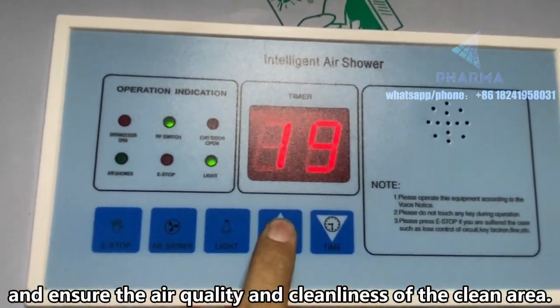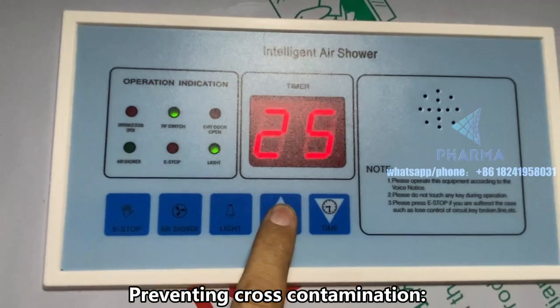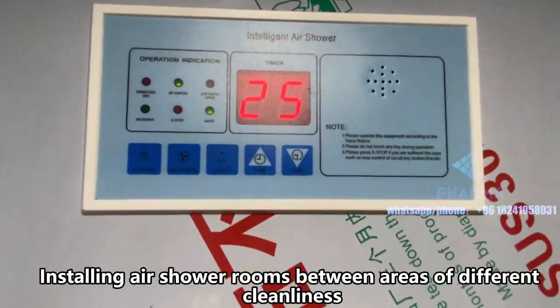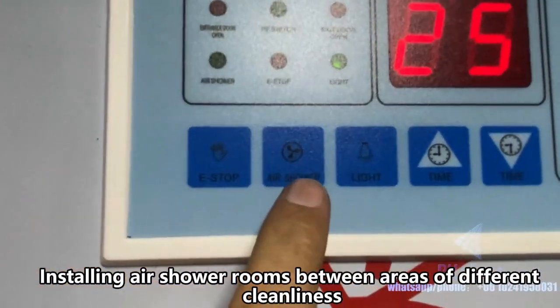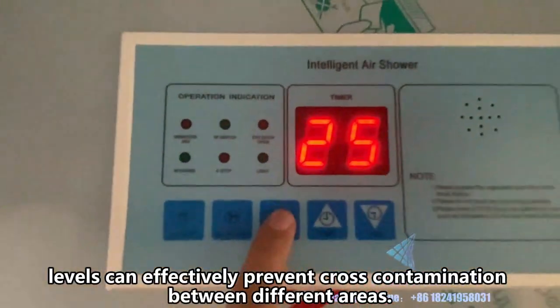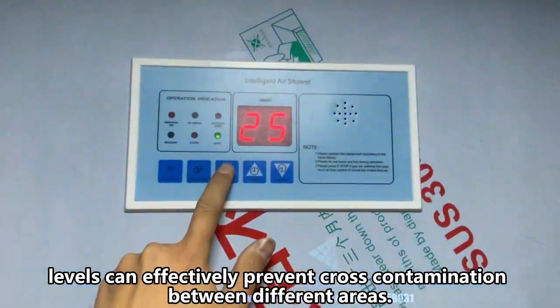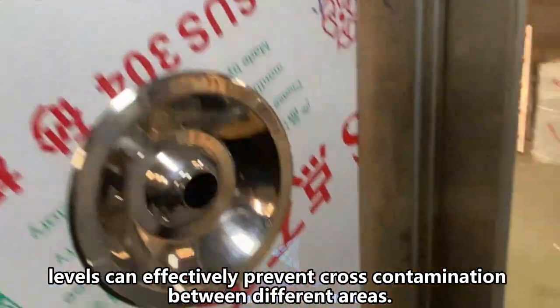This ensures the air quality and cleanliness of the clean area. Main function two — preventing cross-contamination: installing air shower rooms between areas of different cleanliness levels can effectively prevent cross-contamination between different areas.